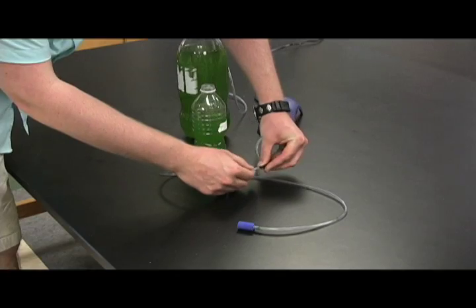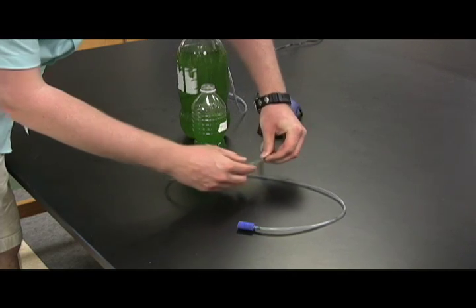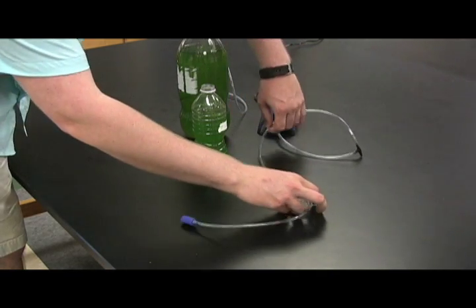From the T adapter, two air lines with air stones are placed through the hole in the lid into the bottles.